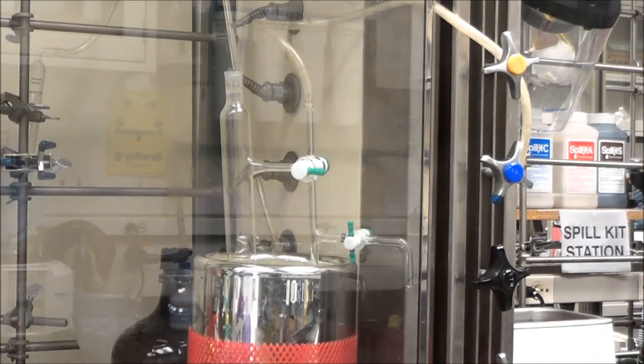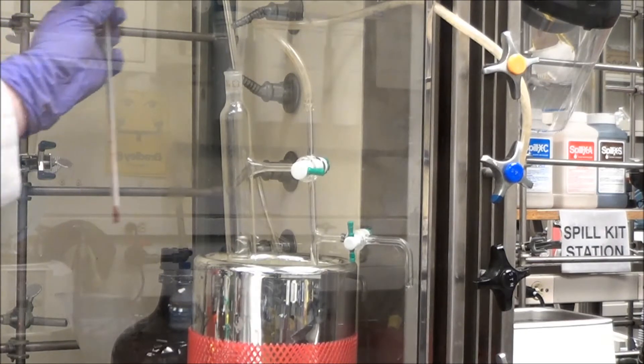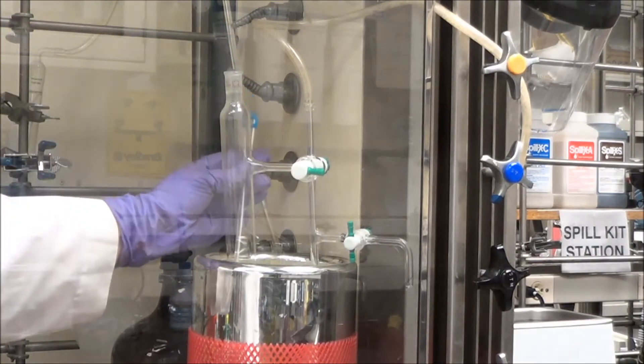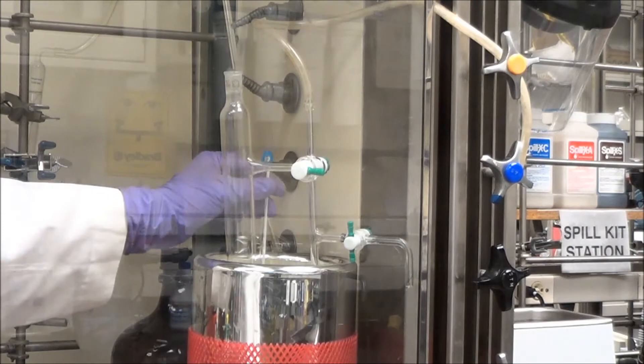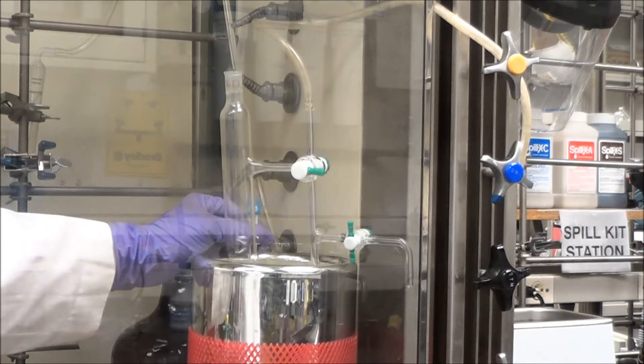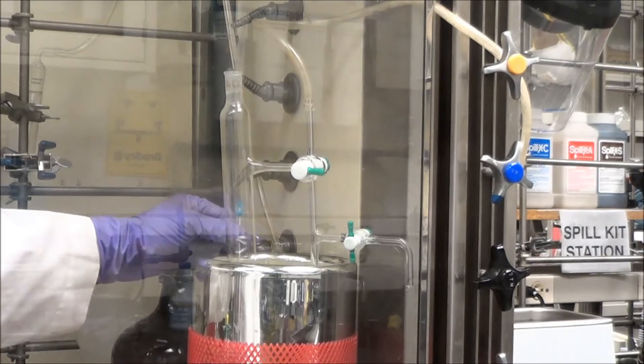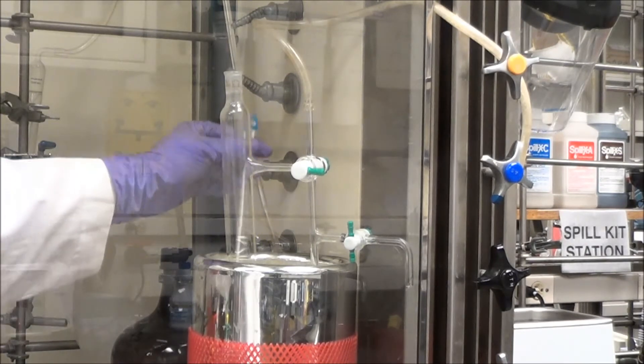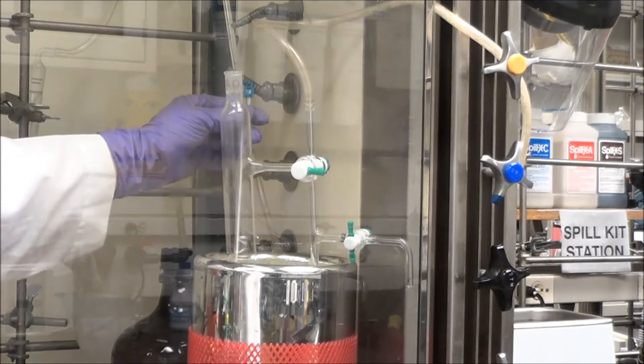And here we go. I'm typically going to wait 20 or 30 minutes, and of course, I'm going to check the temperature. The temperature will go up a little bit, but the heat capacity of a dry ice acetone bath is actually really quite high. So it doesn't go up too much. It does go up, and I do need to watch it for a while.